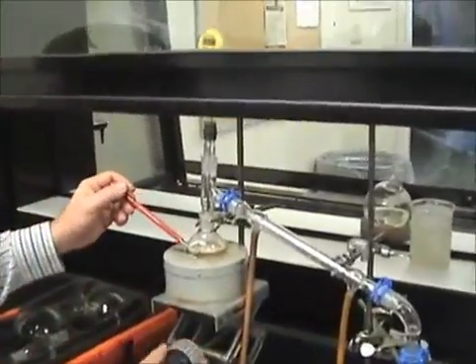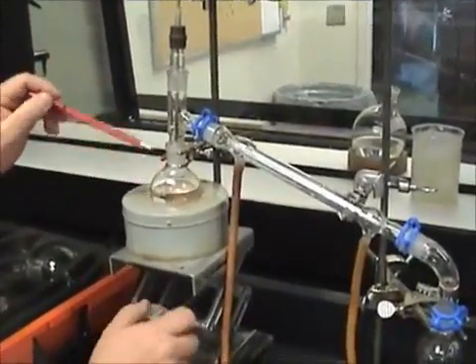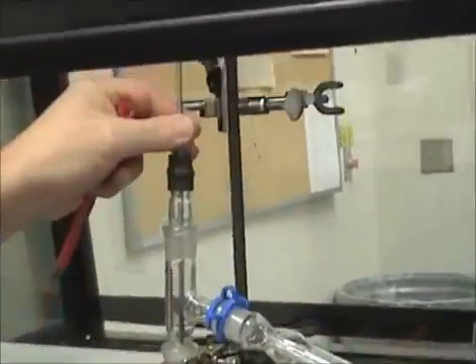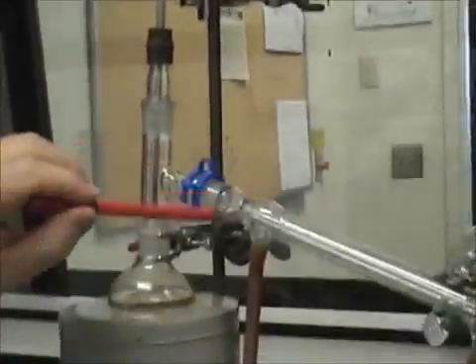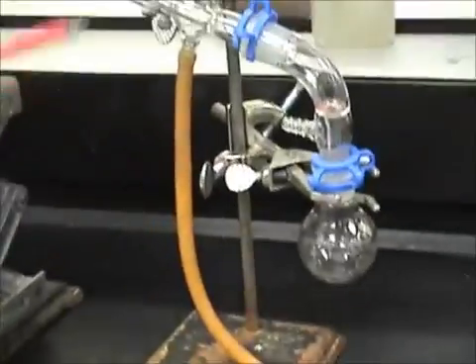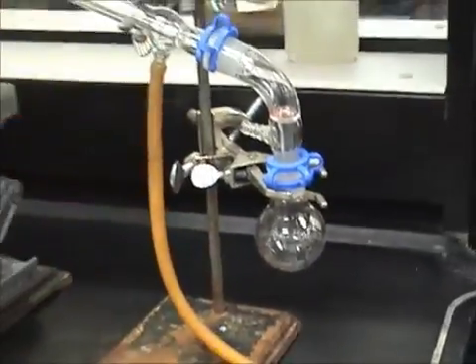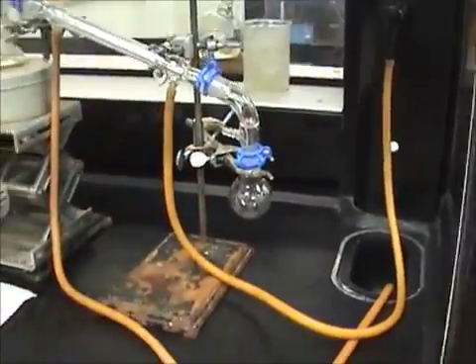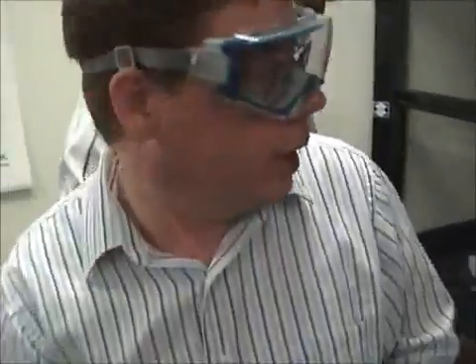Let's see what you've got here, Dave. You've got the flask. You've got some boiling chips in there, I see. Thermometer's just the right height. Looks good and secure in there. This is clipped nicely. Your hoses are good. They're not kinked or anything. They're hooked up the right way so the water flows through. Alright, looks like you're ready to roll. Go ahead and turn your heat on.